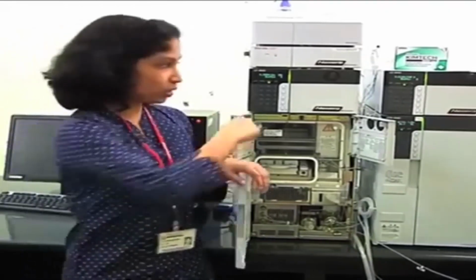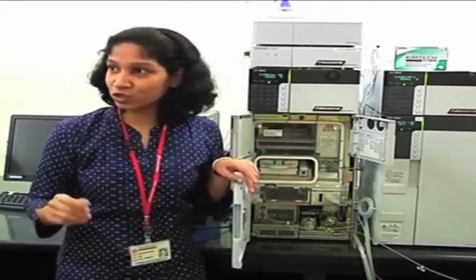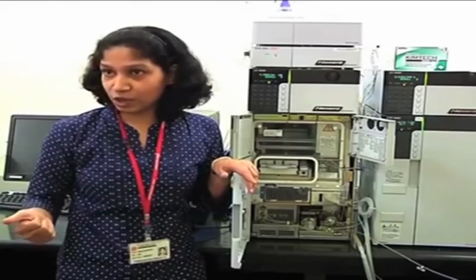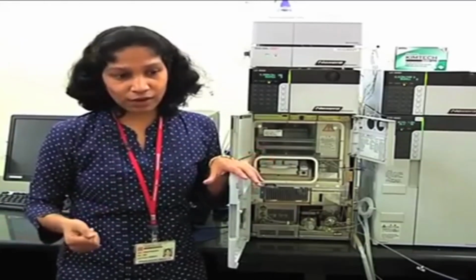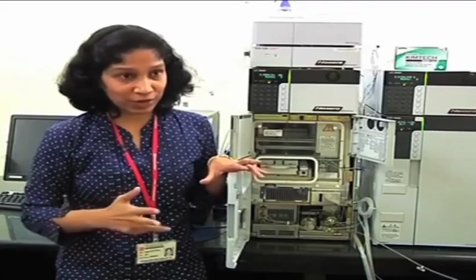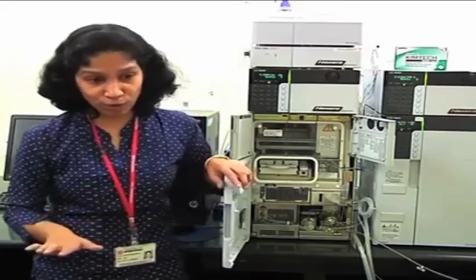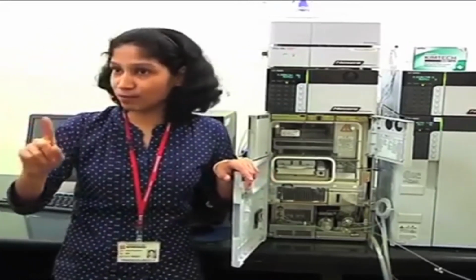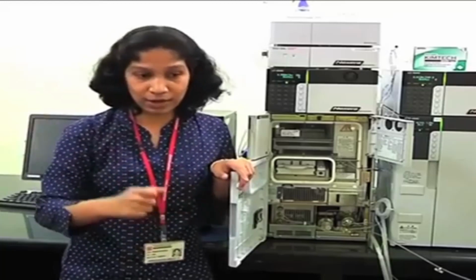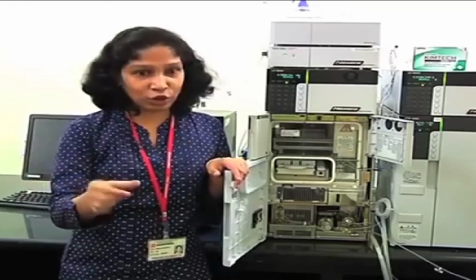Fine. Also, this is a fast autosampler. It takes only 10 seconds to inject 10 microliters of sample. So this particular function is very important when you perform fast HPLC kind of analysis. Because suppose this is generally for a small molecule assay, if you want to quantify only one particular compound in your sample, and your runtime is as short as 1 minute or 2 minutes.